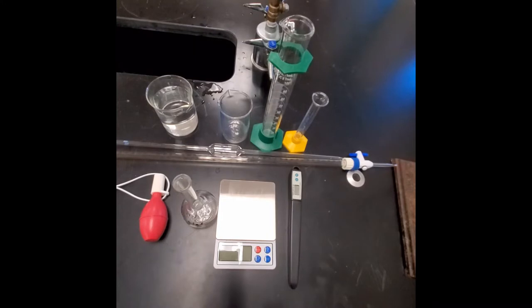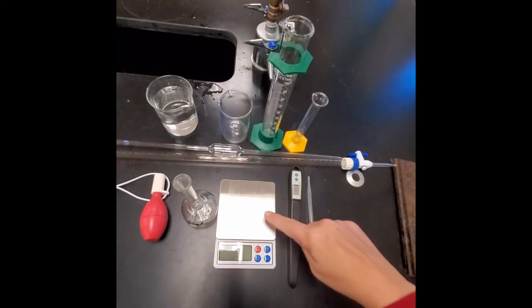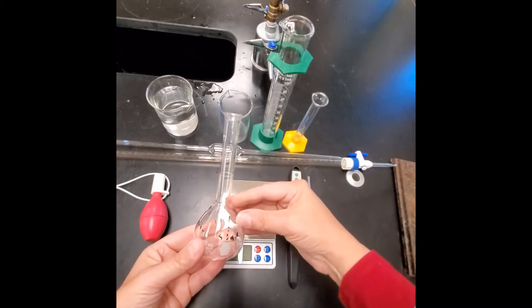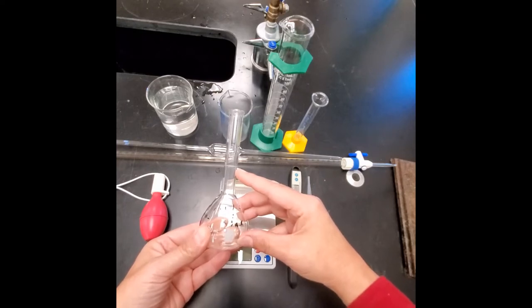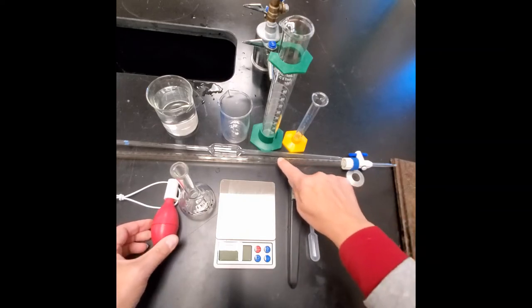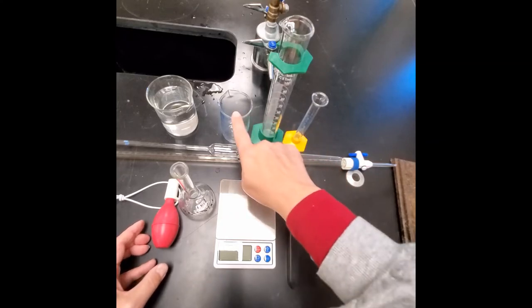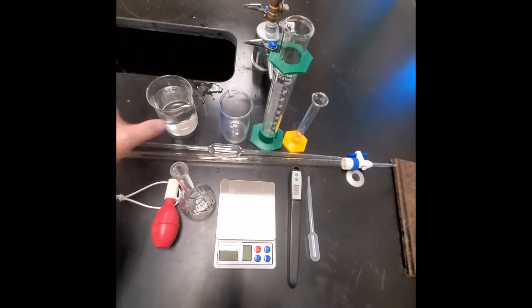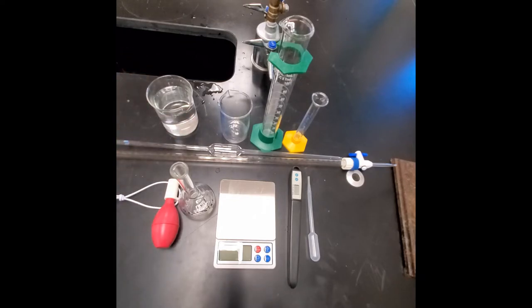The equipment we're using today includes a disposable pipette or eyedropper, a thermometer, an electronic balance, a volumetric flask — this 100 mL flask is designed to contain a set volume — a pipette bulb, a burette, a pipette, two graduated cylinders (10 mL and 100 mL), a 150 mL beaker, and a larger beaker filled with distilled water. You'll grab a 250 mL beaker, go to the distilled water, and that is the water you'll work with for the lab.